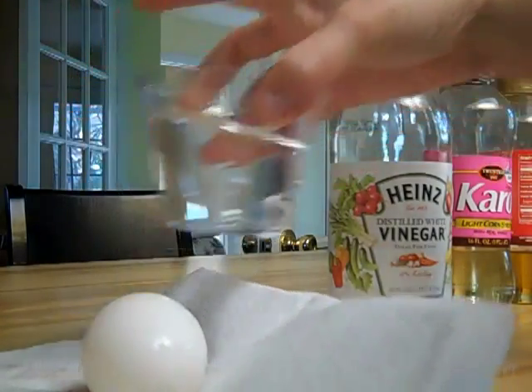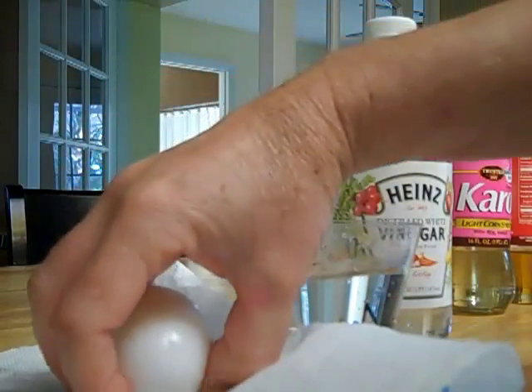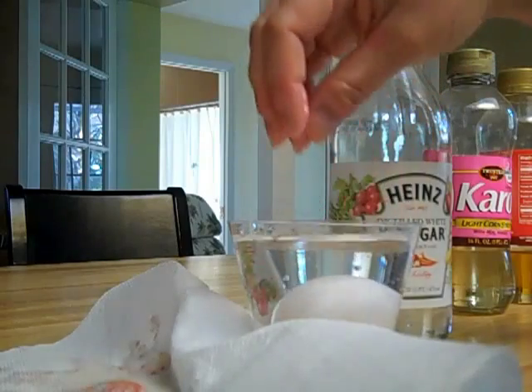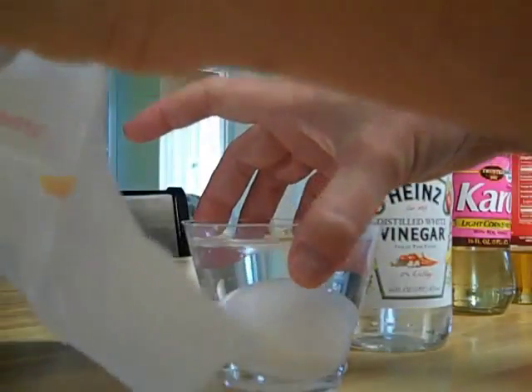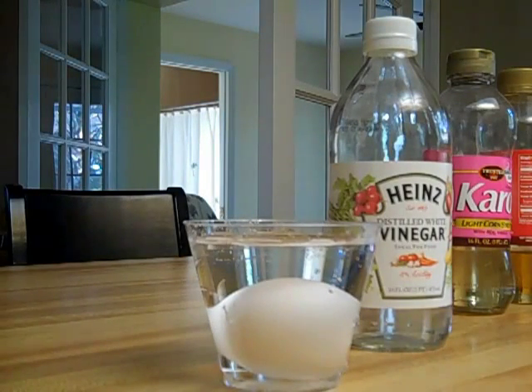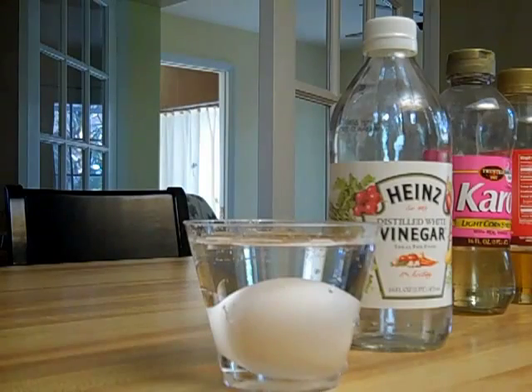I'm going to go ahead and fill this now with just plain tap water, carefully place the egg in there, and now we're going to wait another 24 hours and take another measurement.